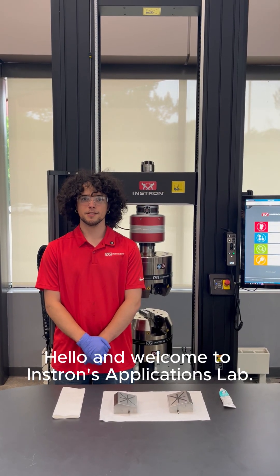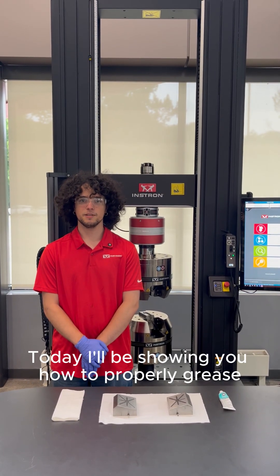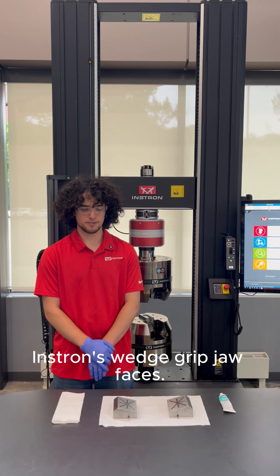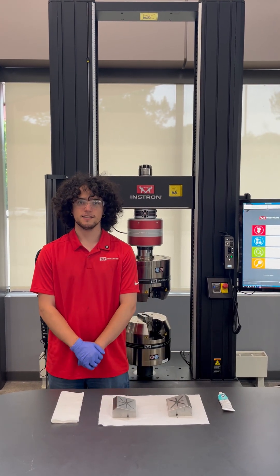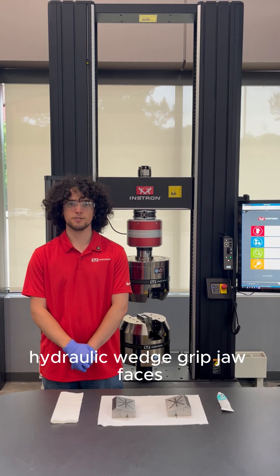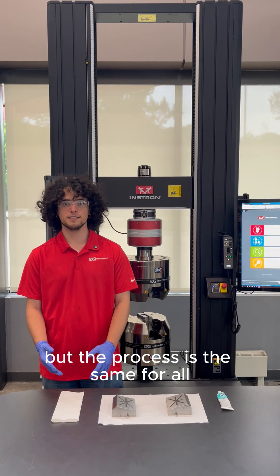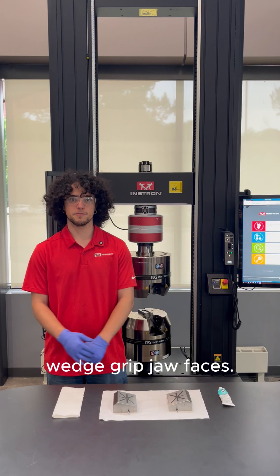Hello and welcome to Instron's Applications Lab. Today I'll be showing you how to properly grease Instron's Wedge Grip Jaw Faces. I'll be using the 300 kN hydraulic wedge grip jaw faces, but the process is the same for all wedge grip jaw faces.